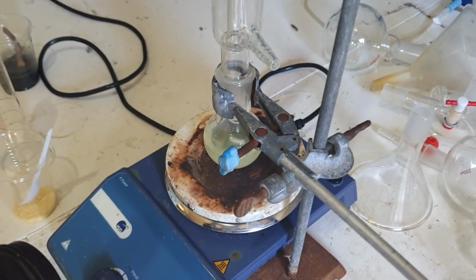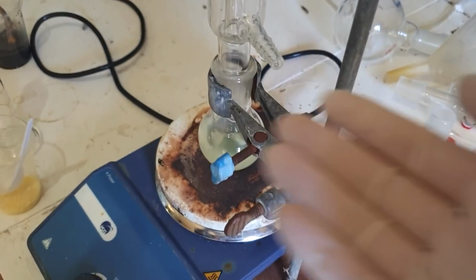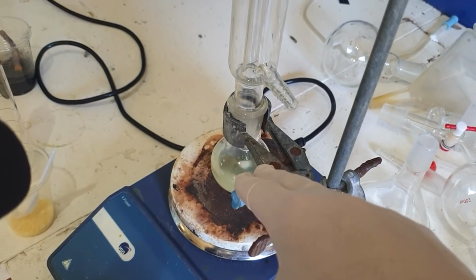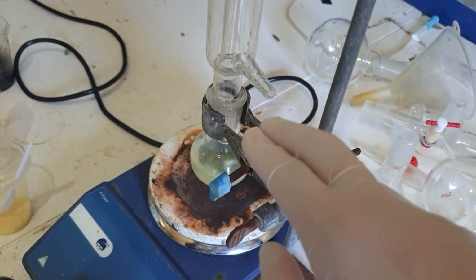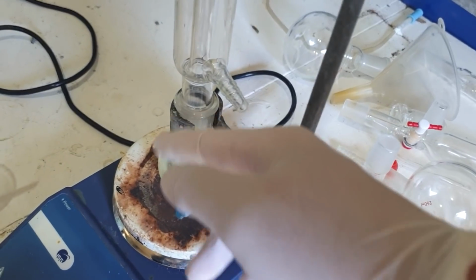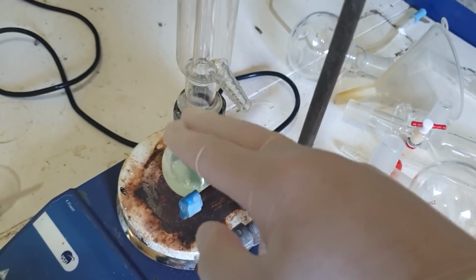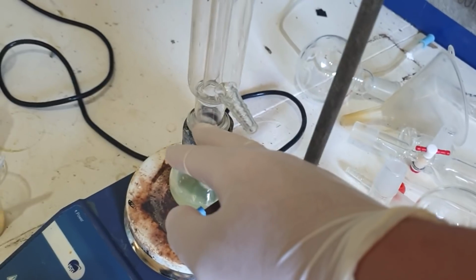And I will say, I'm generally pretty relaxed about greasing joints. I tend not to do it as much as the rest of the world tends to. But for reaction mixtures like this, where we've got sodium hydroxide in ethanol, that mixture can etch glass ever so slightly, especially while hot. It's not going to damage the flask, really, but if it can get in the joint and then be heated, because it's a ground glass joint, it's got a lot of surface area between two things, it can very easily fuse the two together. When dealing with very basic stuff, you've got to really worry about your joints.